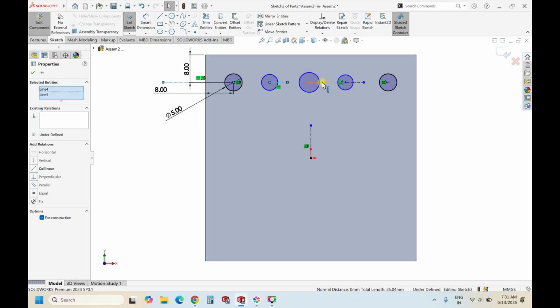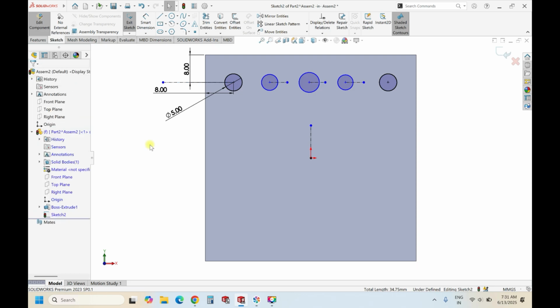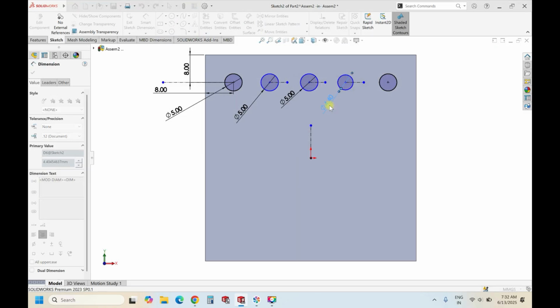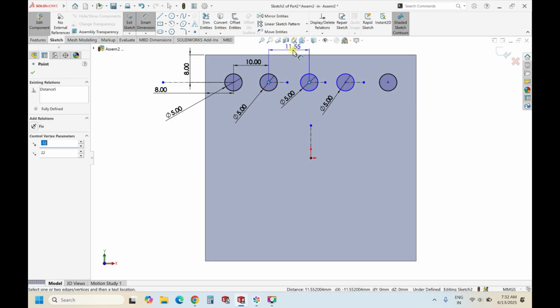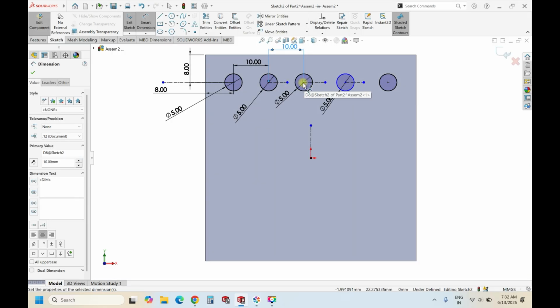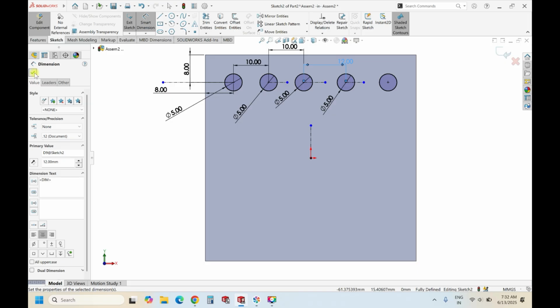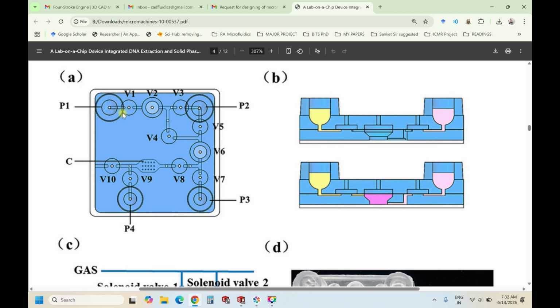Okay, make collinear. Now everything is in line. And now let's give the dimensions. So this is done. So basically we have created P1, V1, V2 and V3 and P2.